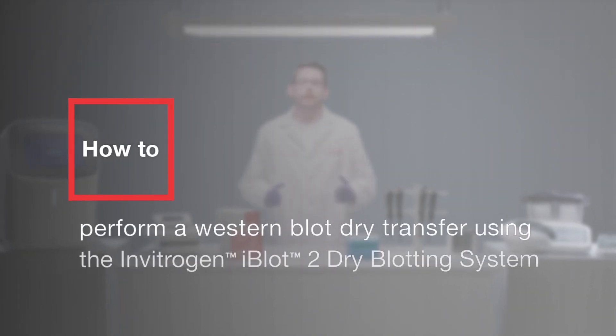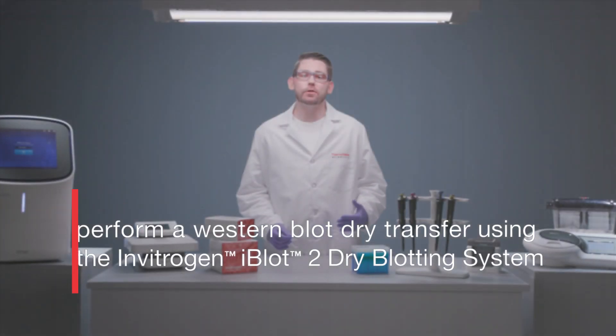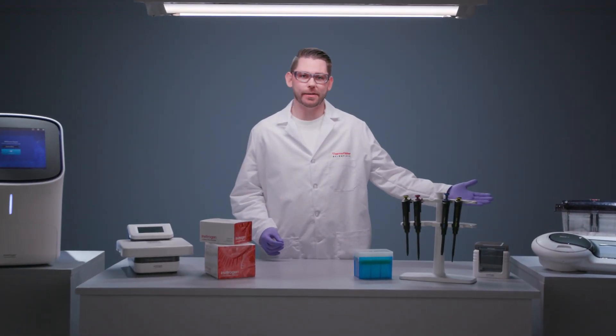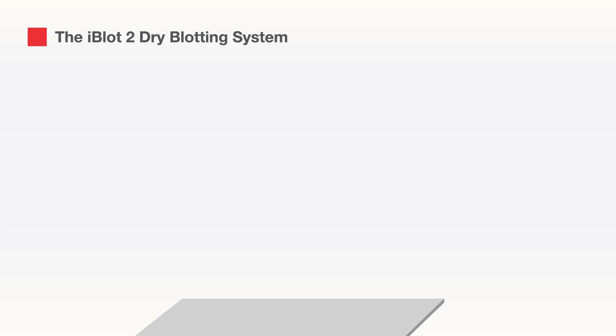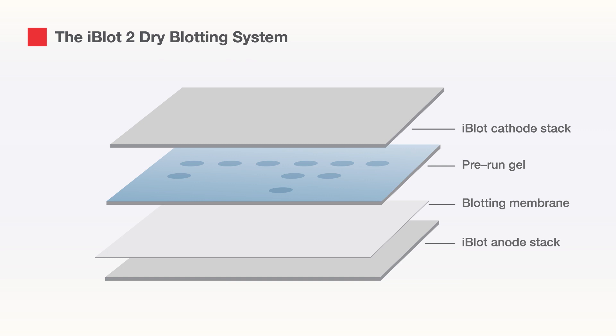In this video, you'll learn how to transfer protein from polyacrylamide gels to membranes using the Invitrogen iBlot2 Dry Blotting System. The iBlot2 Dry Blotting System uses pre-assembled transfer stacks with integrated nitrocellulose or PVDF membranes, offering the convenience of a bufferless plug-and-play system.